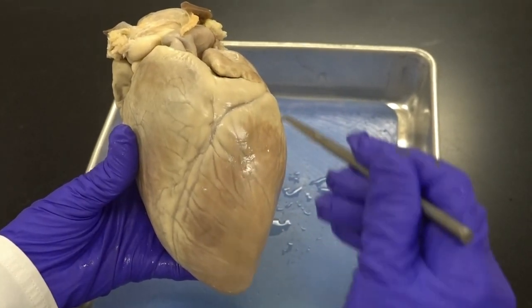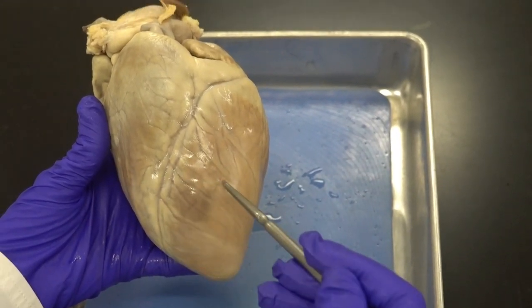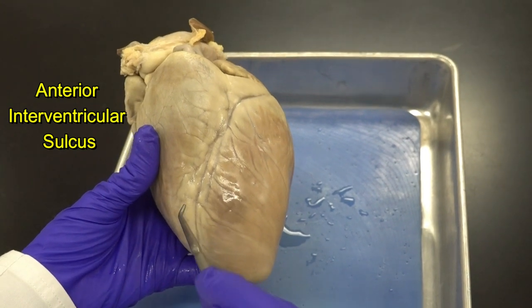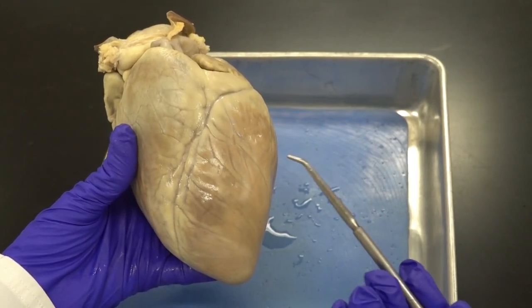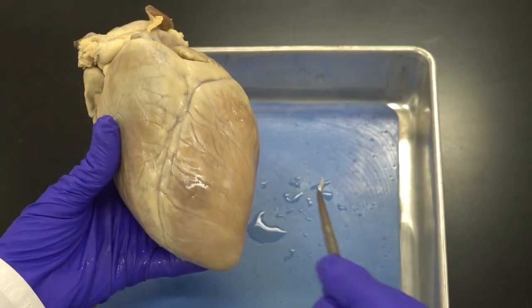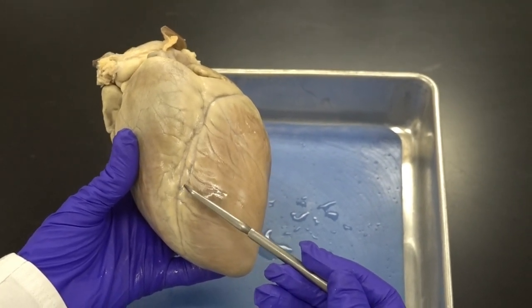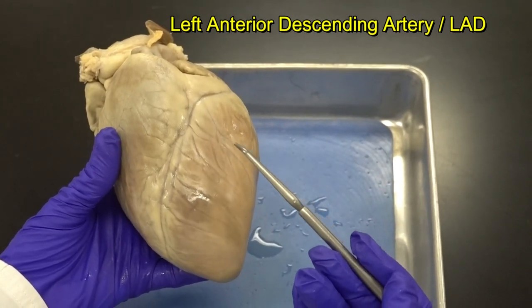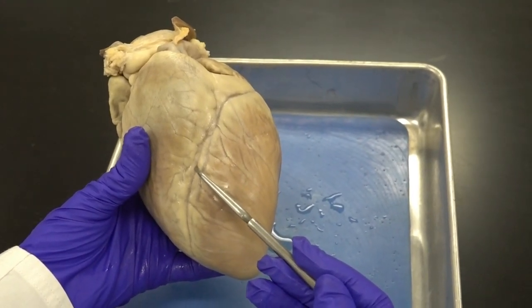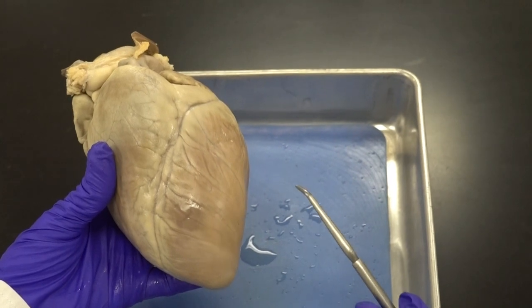This is the anterior view of the pig heart — here is the right ventricle and this is the left ventricle. Between the two ventricles anteriorly we have a sulcus called the anterior interventricular sulcus. In this sulcus we find adipose tissue and important arteries such as the anterior interventricular artery — also known in clinical practice as the left anterior descending artery or LAD — which supplies both ventricles anteriorly and is a branch of the left coronary artery. We also find the great cardiac vein here.